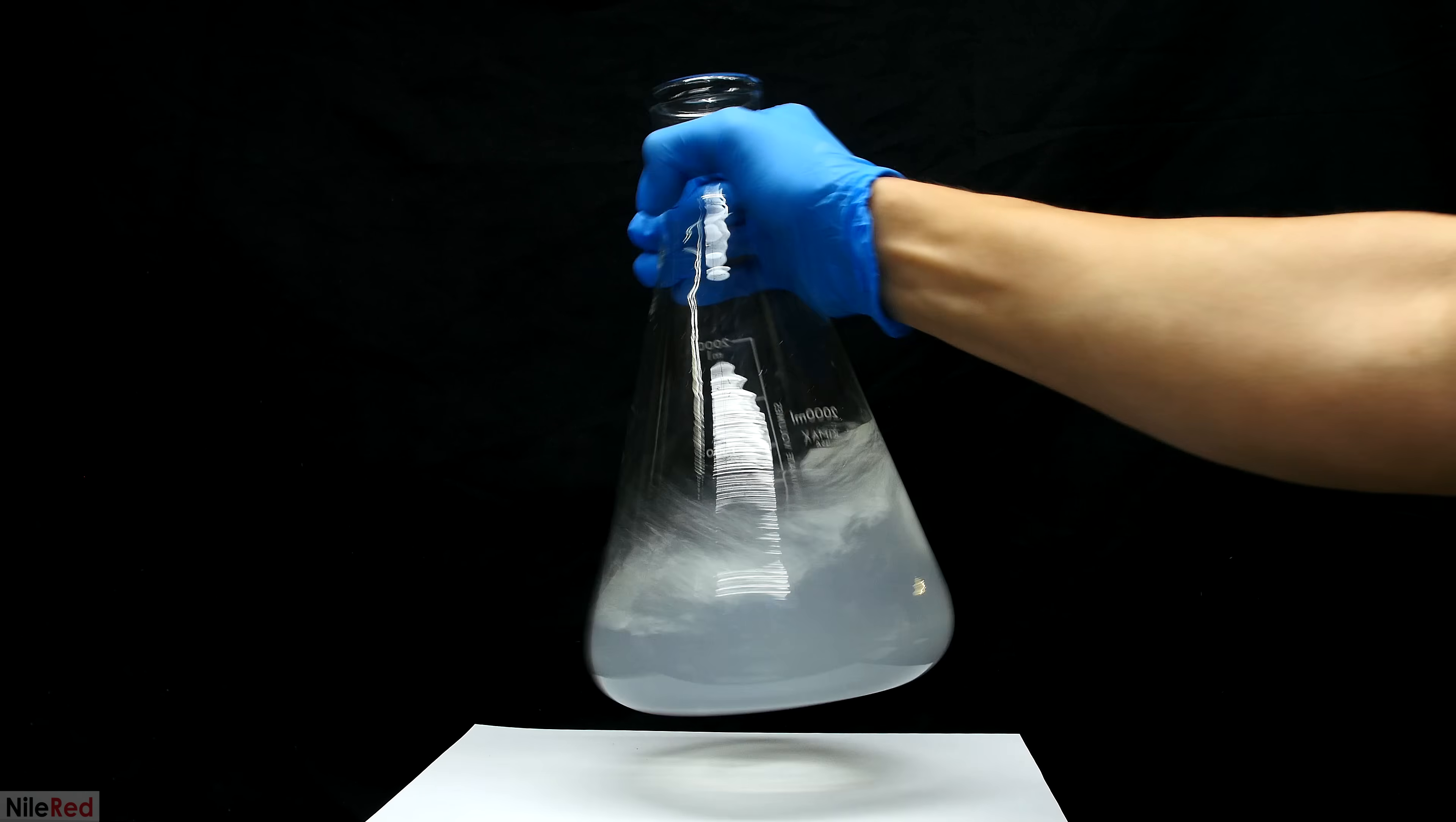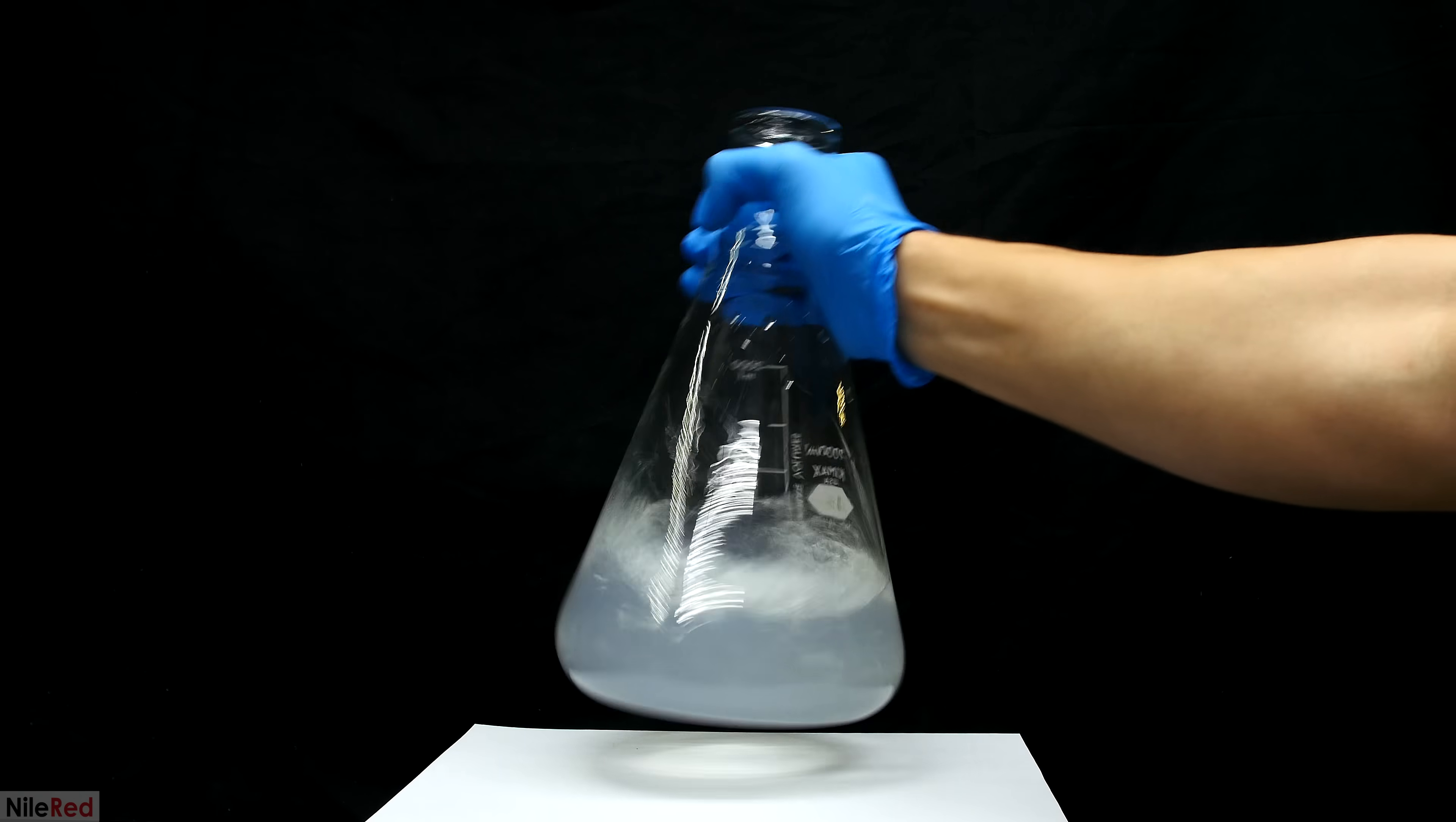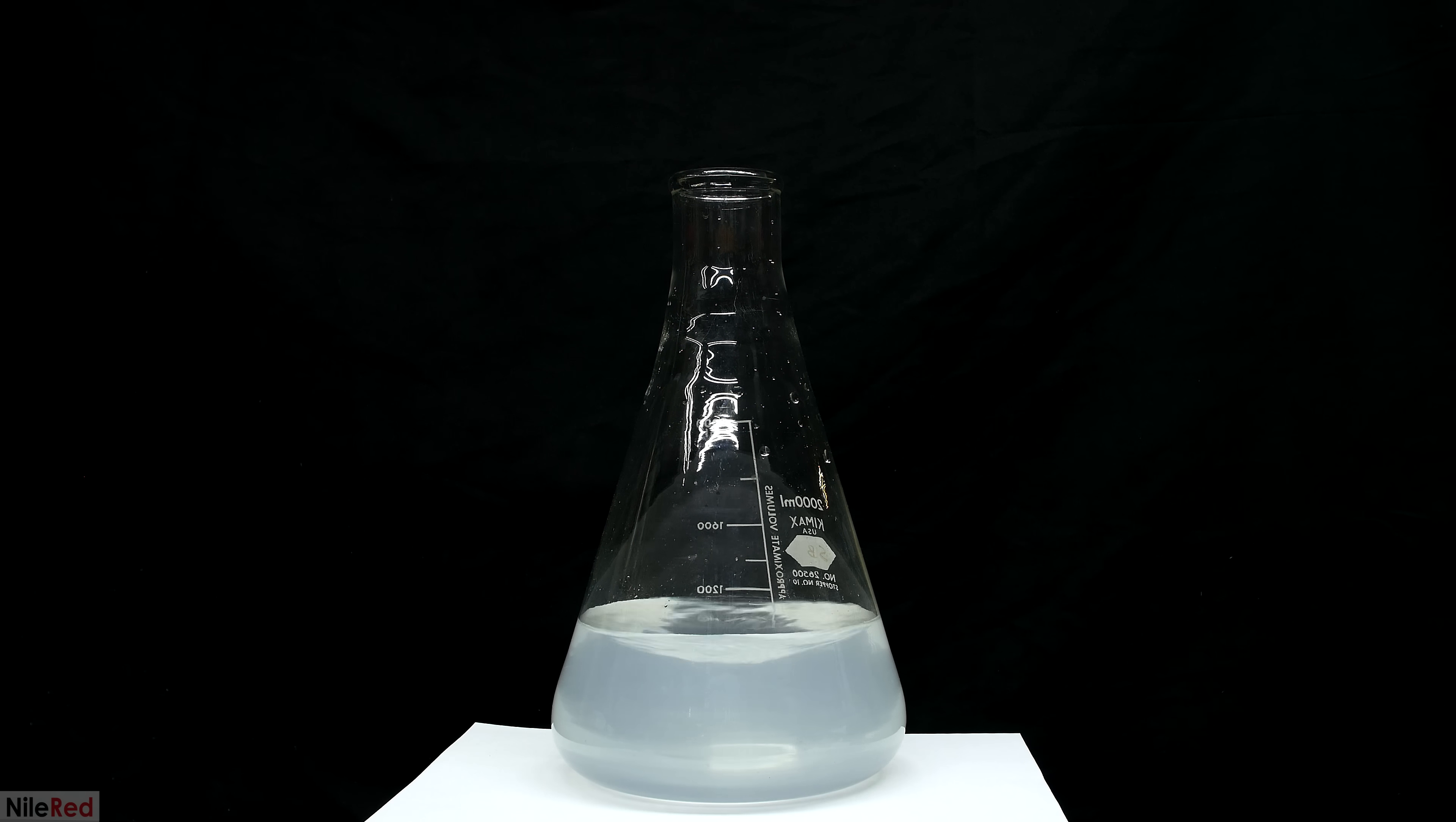My solution here is still cloudy, and this is because the silver nitrate that I used wasn't super pure. I mean, I did make it myself, so I assumed it would be super pure and amazing quality, but apparently I'm not as good as I thought.